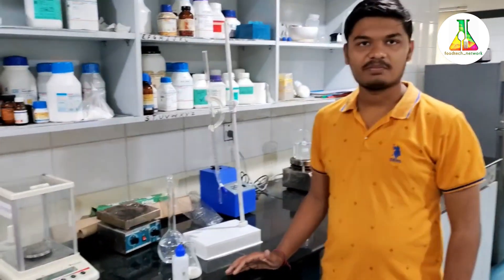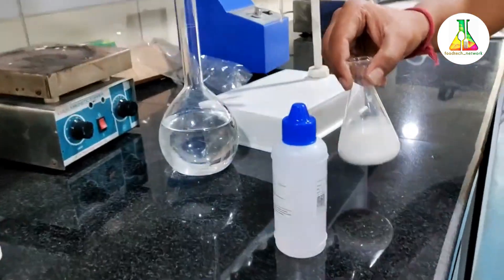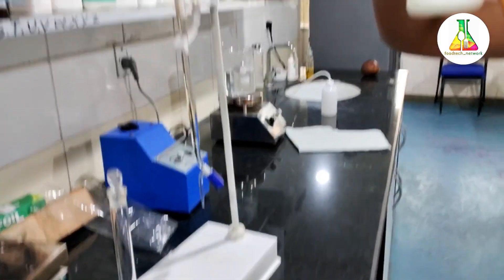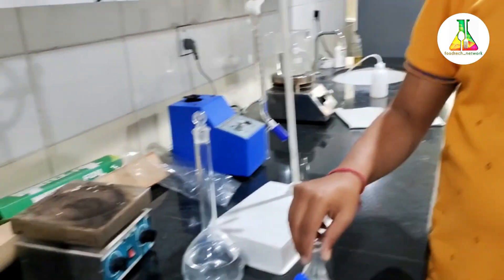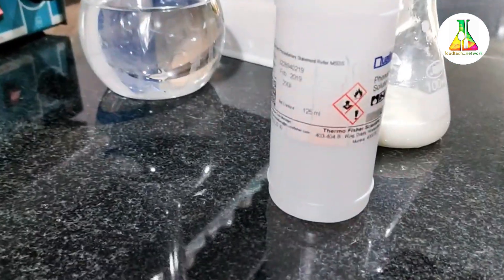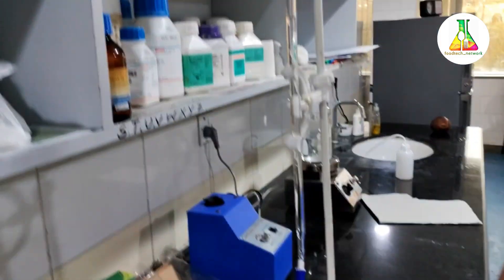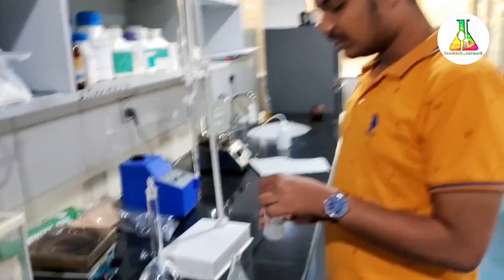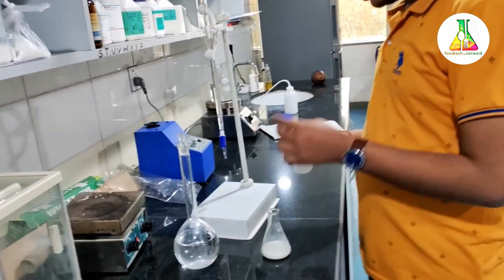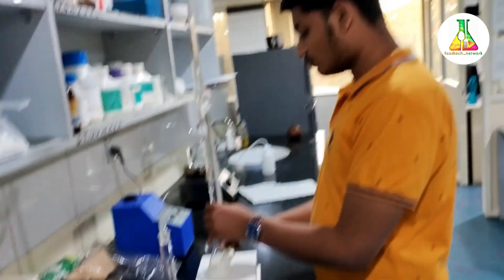Let us see what we need for our experiment — the determination of acidity in milk. pH is very important for the stability and shelf life of milk. We have taken our milk sample, around 25 ml, though the volume can be changed but the calculations would differ. We need phenolphthalein indicator, and for titration we are using 0.1 normal solution of sodium hydroxide filled in a 25 ml burette. We add a few drops of phenolphthalein indicator to the milk sample, gently mix it, and titrate against sodium hydroxide.